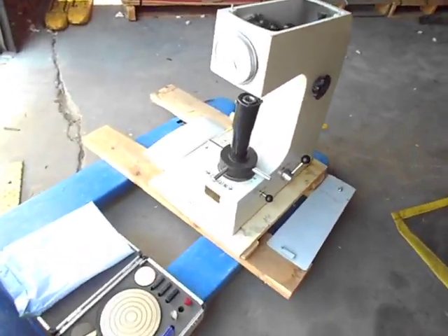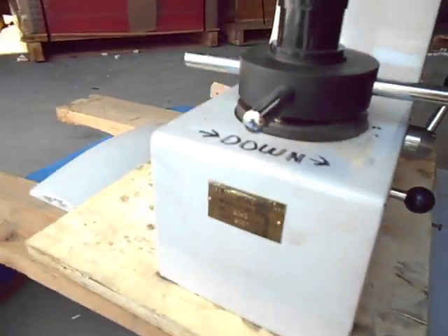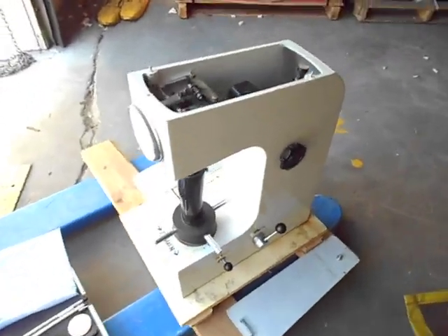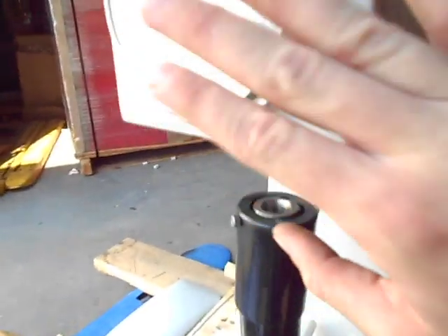Here today we have a Rockwell hardness tester, HR150A. It's going to be sold as parts repair due to the fact that we believe it's inoperable. The dial doesn't move when there's any load put under here. You can see that, actually you might be able to see better from this way.